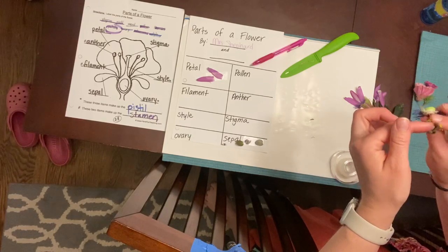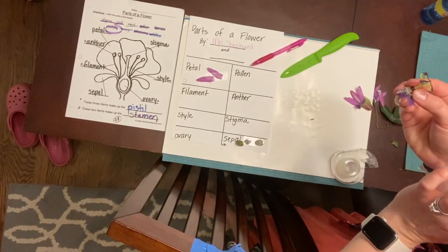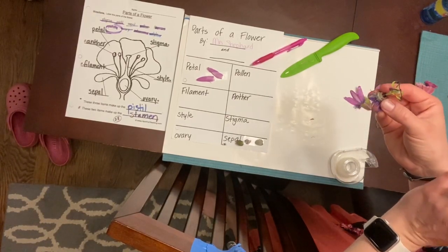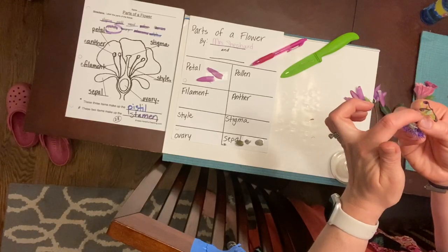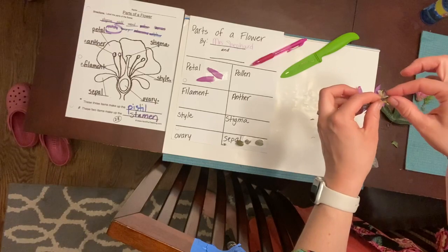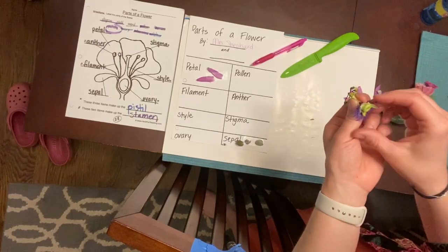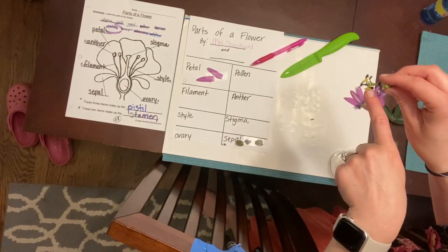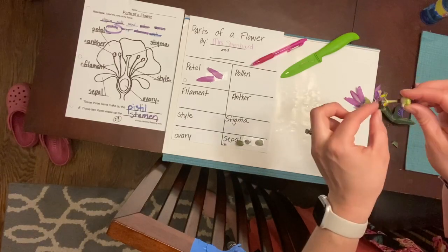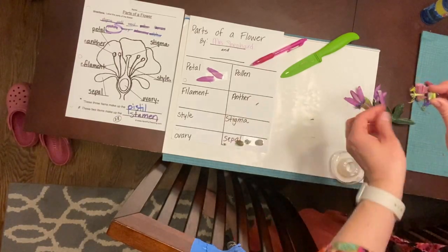And I am going to observe my flower, and I'm going to see which part seems to be the pistil and which part seems to be the stamen. So the pistil is going to be the part that's connected to this part here, and it's going to be that part. Oh yeah, and look, see, there's all the pollen here. So that means that these are the anthers. So I'm going to take off the little yellow anthers with the pollens, okay?